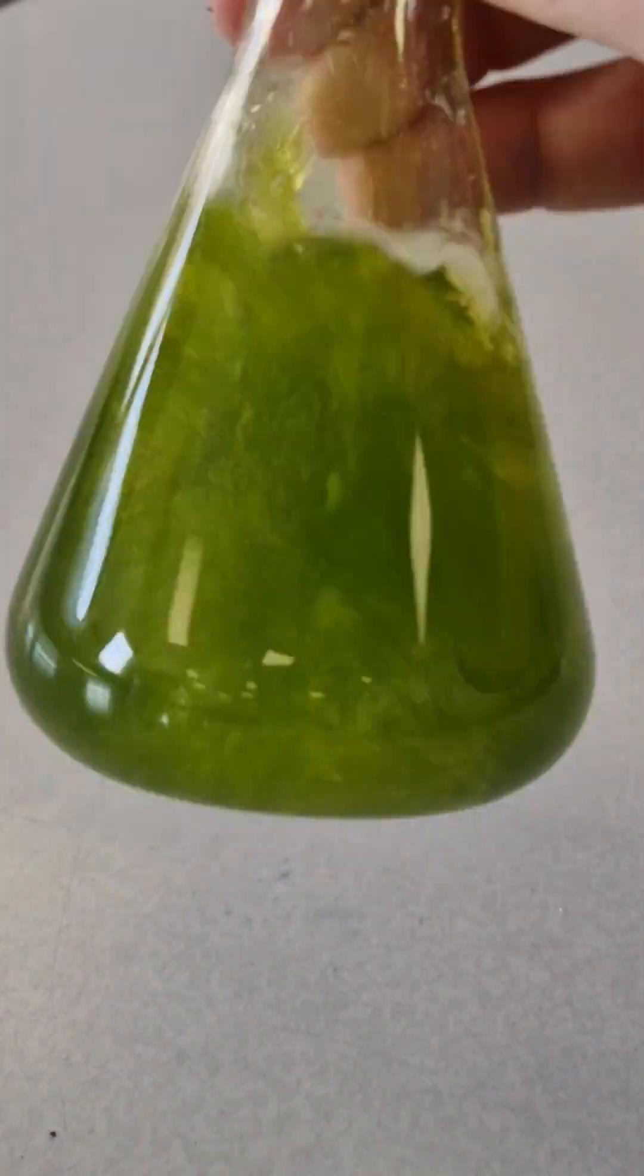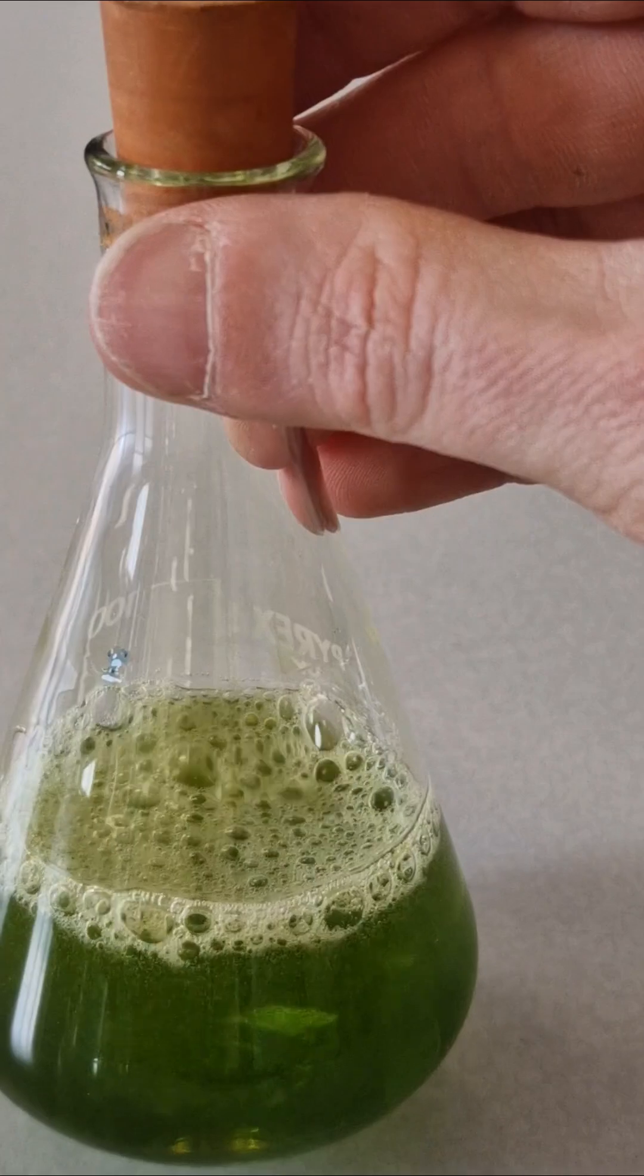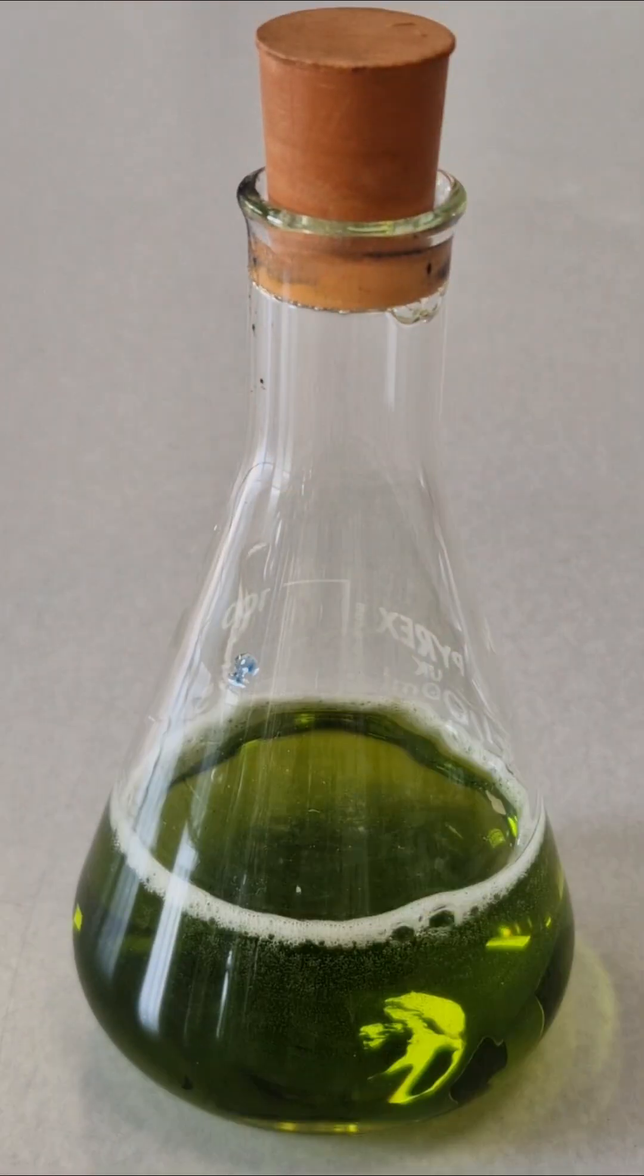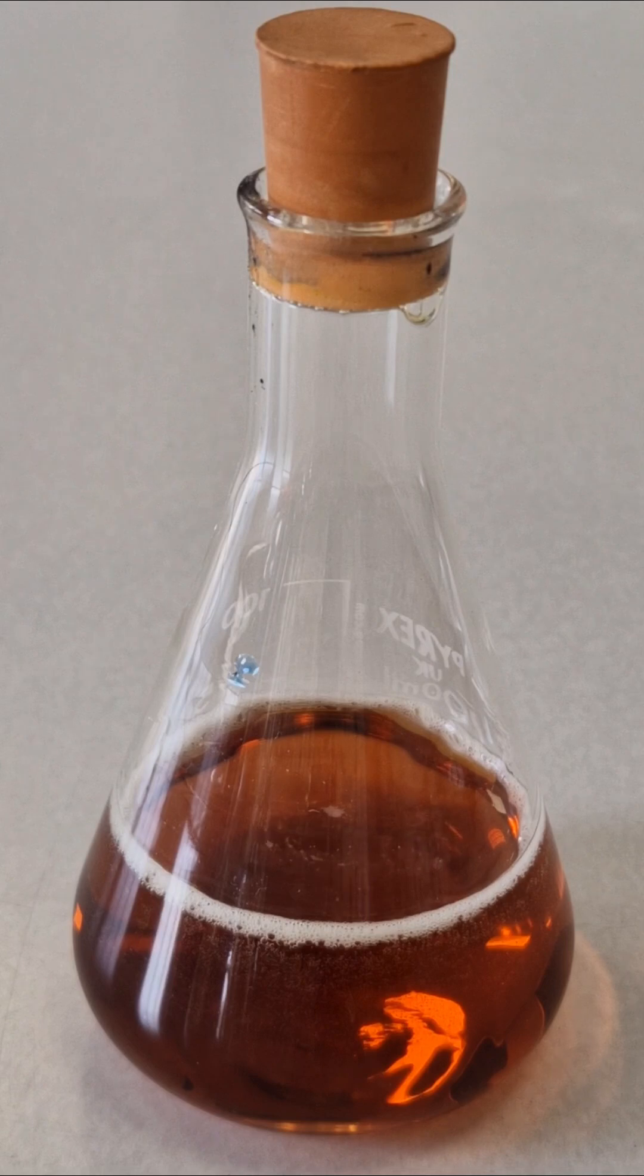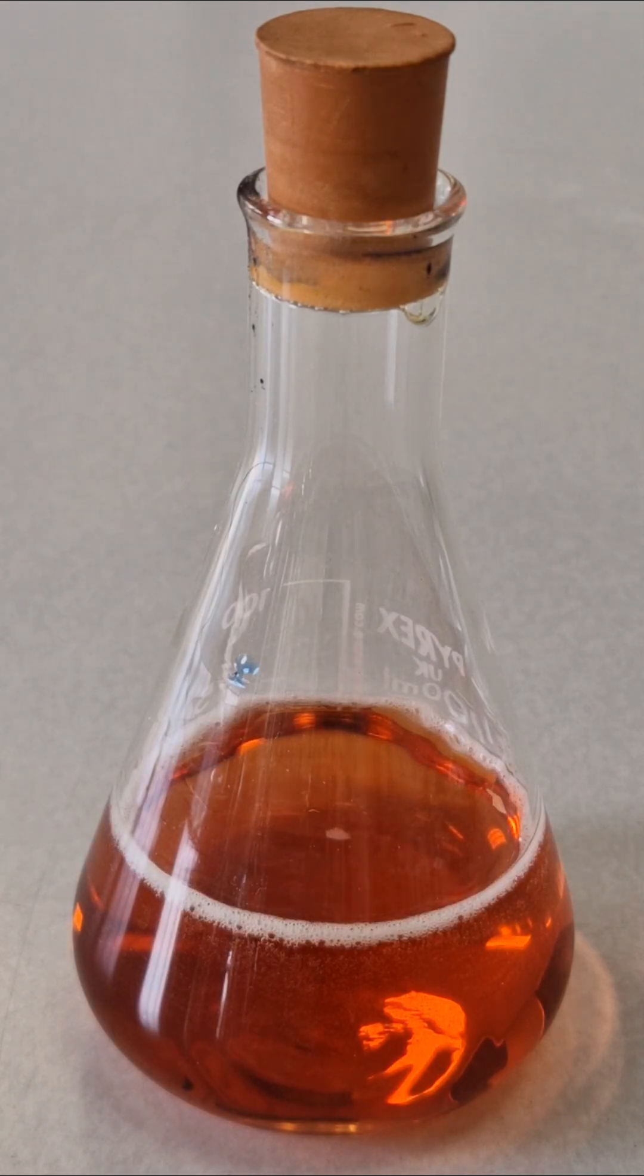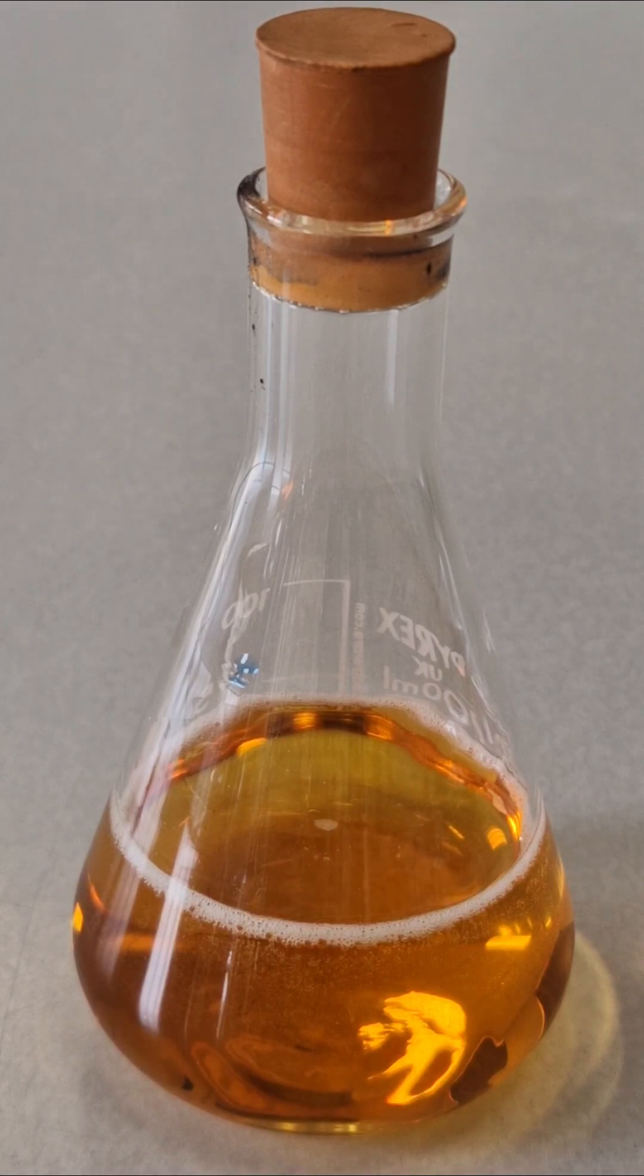What will happen when we shake this yellow solution? Shaking turns it red and eventually green. But when left to stand on the table, the red coloured solution we briefly saw reappears. And in fact, if we leave the solution for longer, it eventually turns back to the original yellow colour we saw at the start.